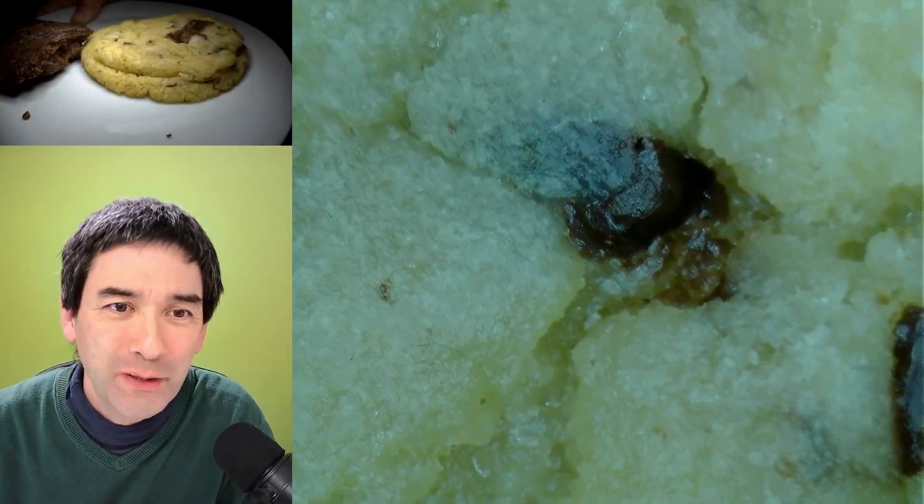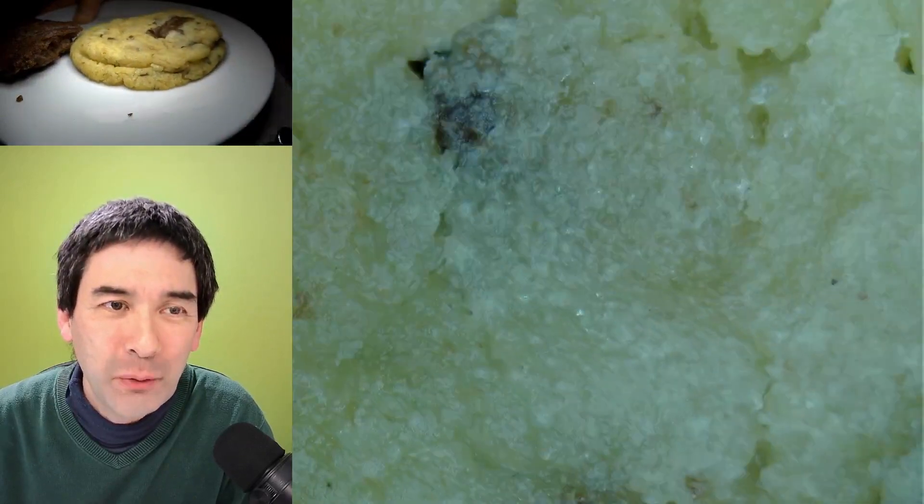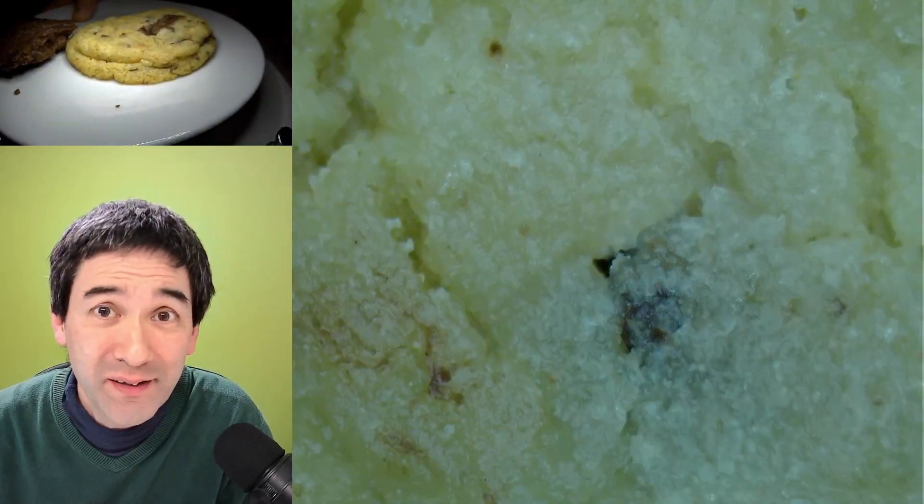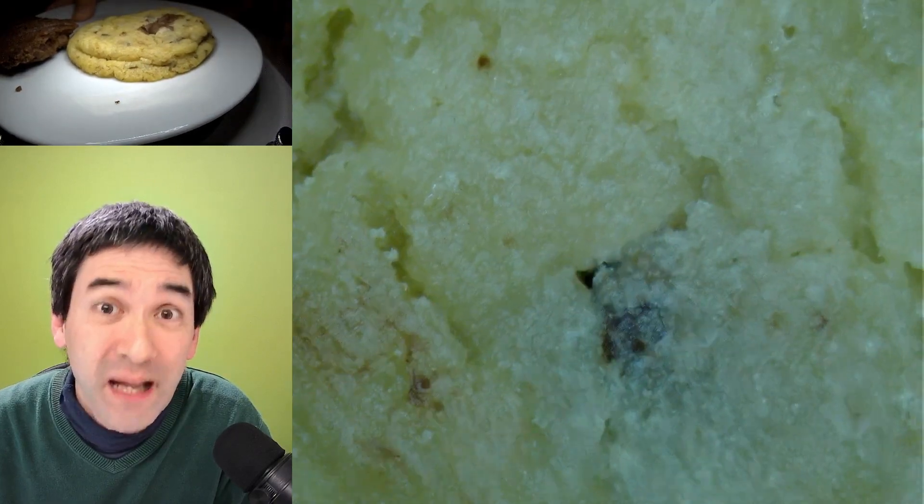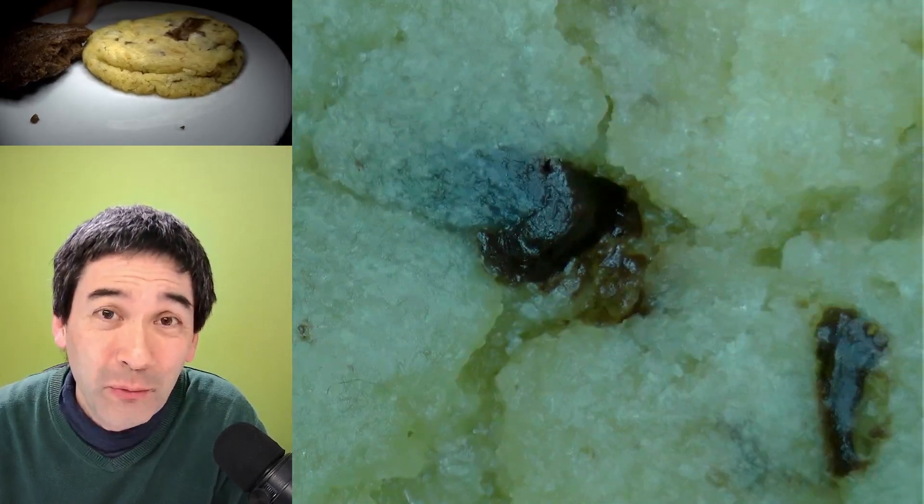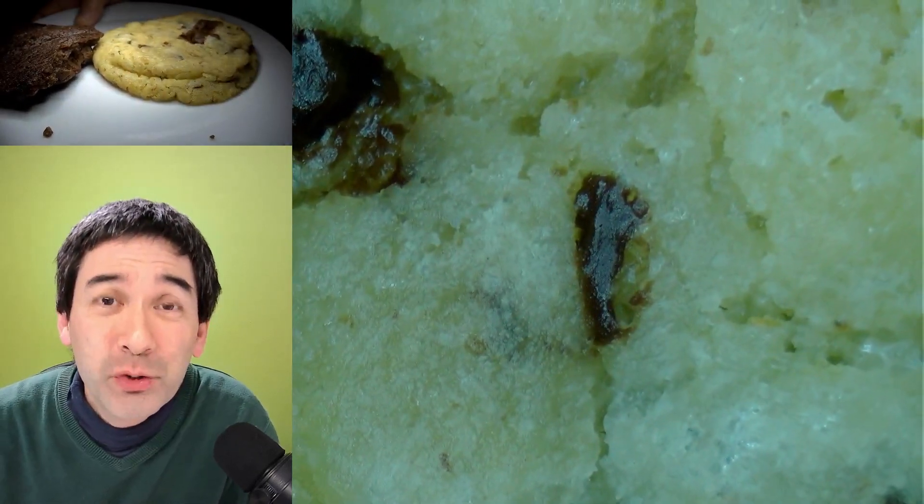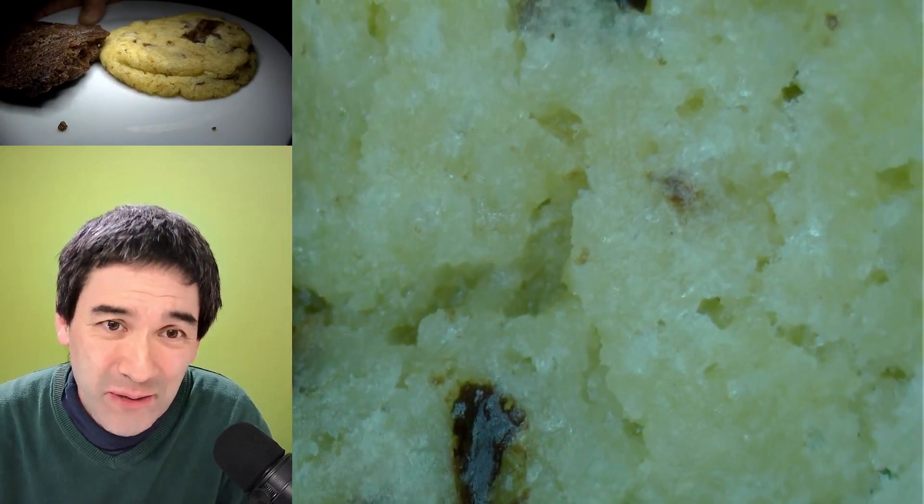Look, nice chocolate pieces in here. What I'm going to do now is take small pieces of both of these cookies and try to feed my slime molds. Then we have to be patient a little bit. Maybe tomorrow or the day after tomorrow I'll be able to report back which one of those two cookies the slime mold likes to eat most.